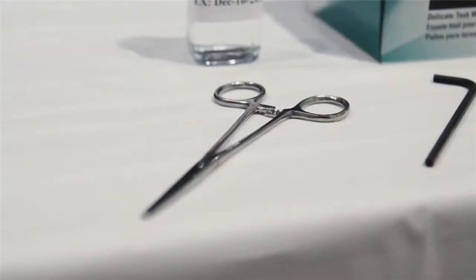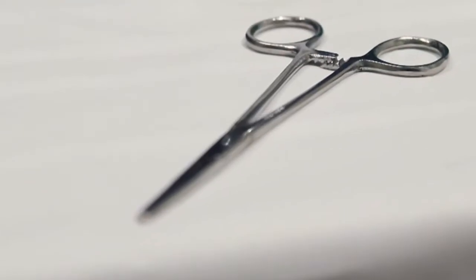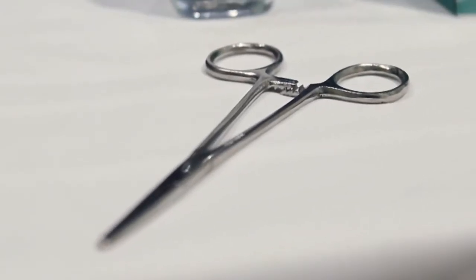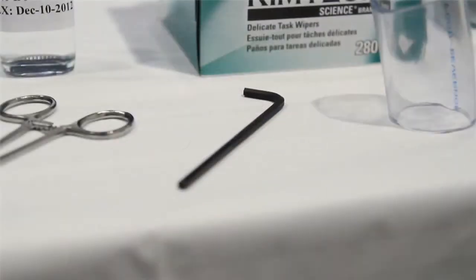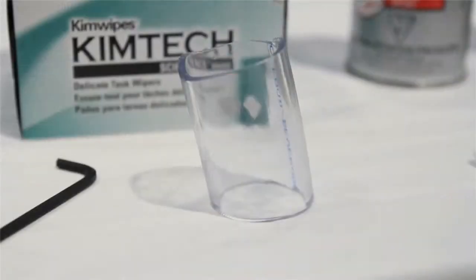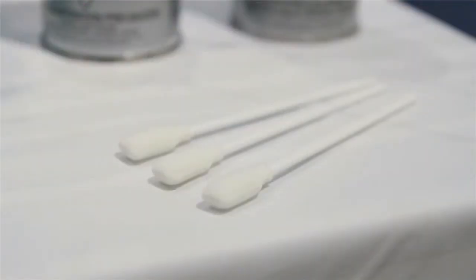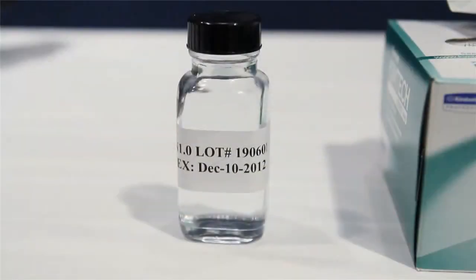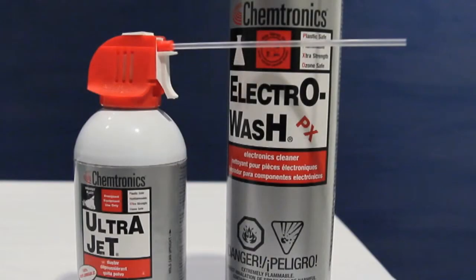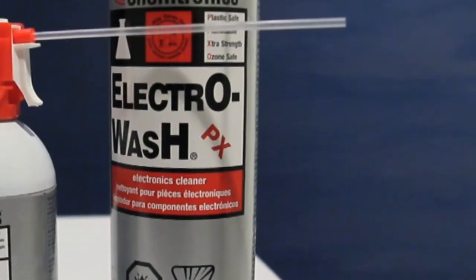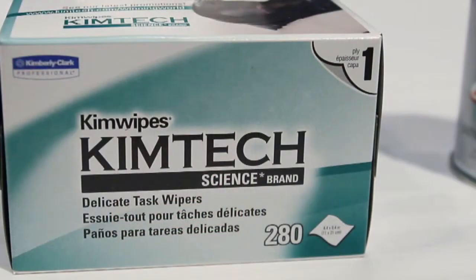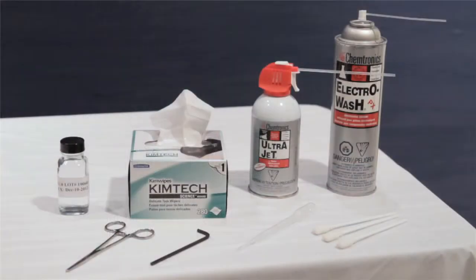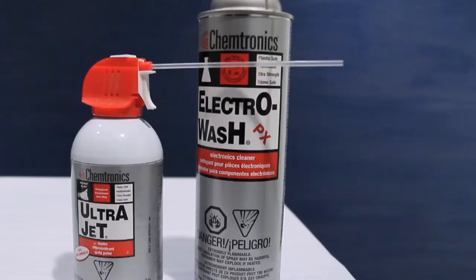Forceps included in the accessory kit. Please avoid coarse pliers that could gouge the stainless steel surface of the measurement chamber. The supplied Allen wrench. A 2-inch length of 1.25-inch ID clear tubing. Foam tipped swabs. A known viscosity testing fluid. A charged canister of clean gas for blowing the sensor out. This is optional. A non-abrasive solvent for your process fluid. Lint-free tissues. These all come in an accessories kit except for the CO2 and the solvent.